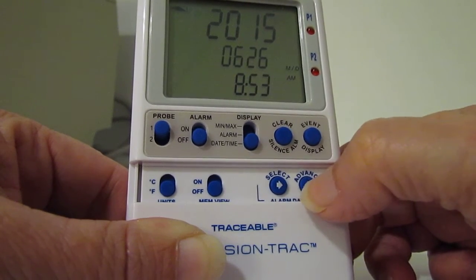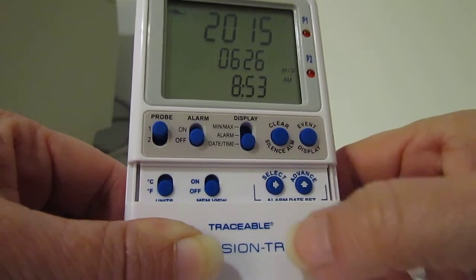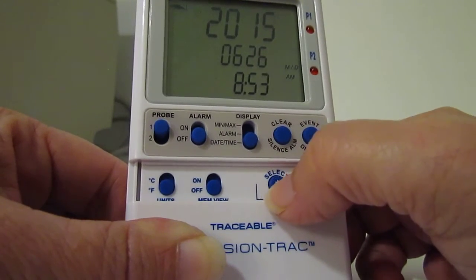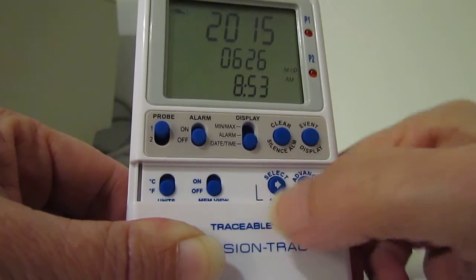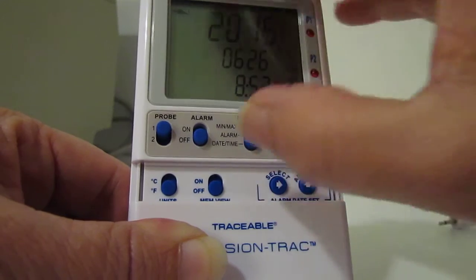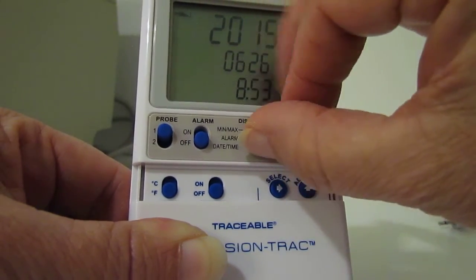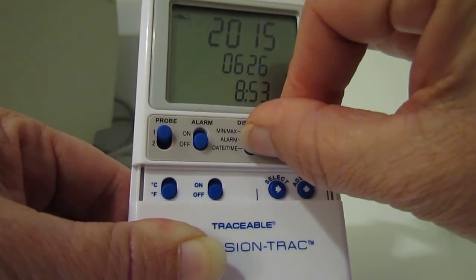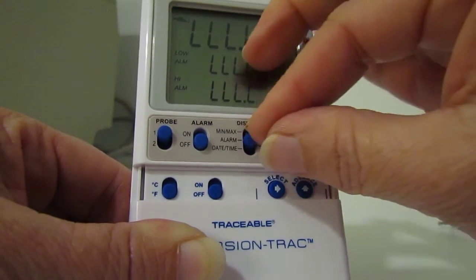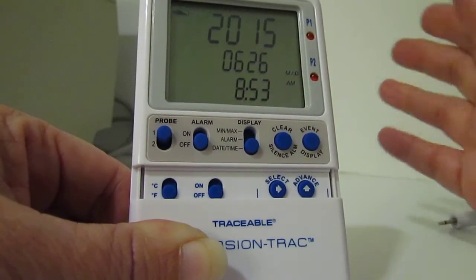Once you've set your date and time, press select, then move the display key — this will save it. Once that's done, your date and time is set.